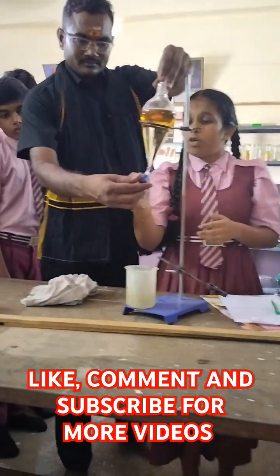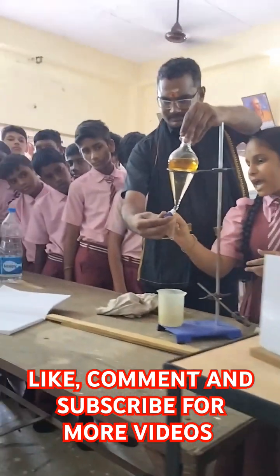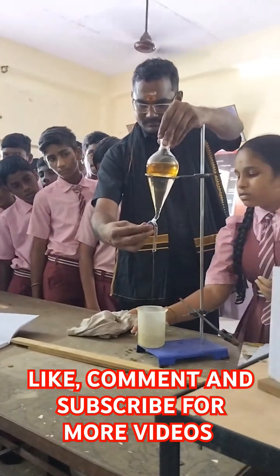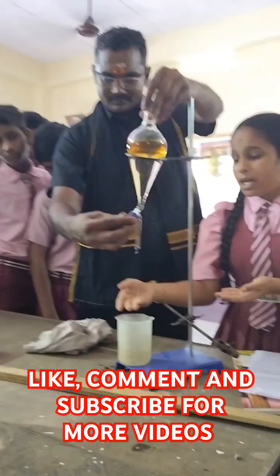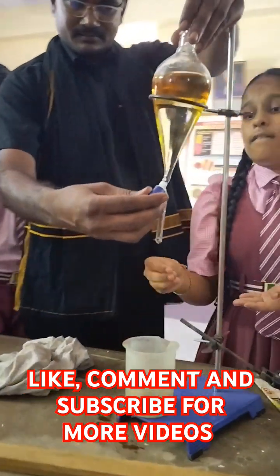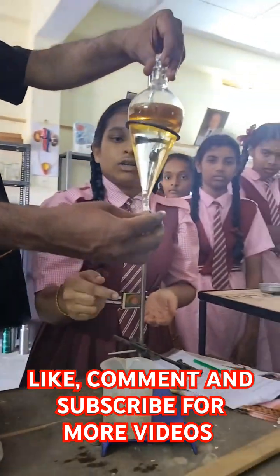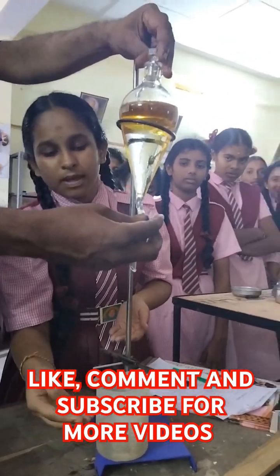Now we can open the cap of the jar. Then the water comes into the beaker. We can see the water coming drop by drop into the beaker.